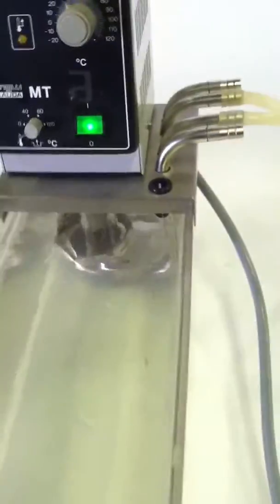So here's your recirculation loops, and the outer ones are not used. Runs on 115 volts.